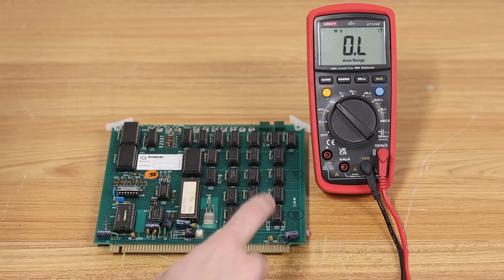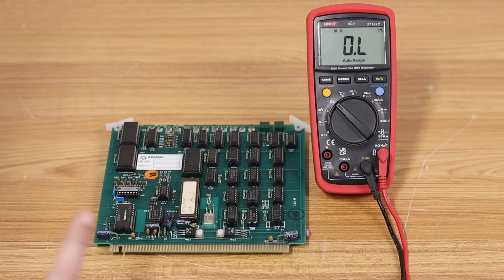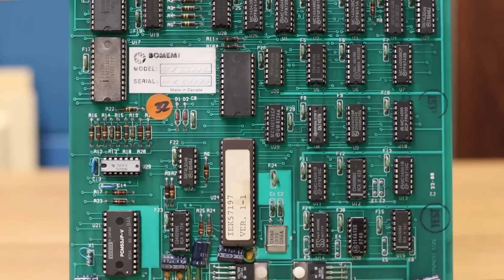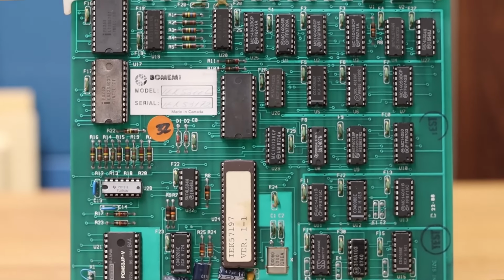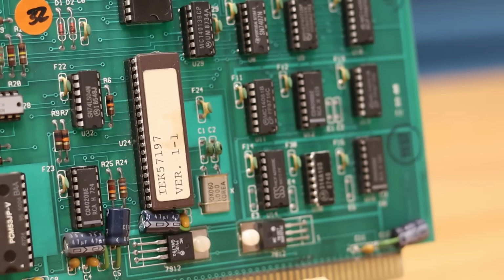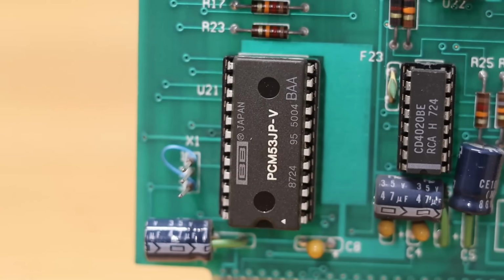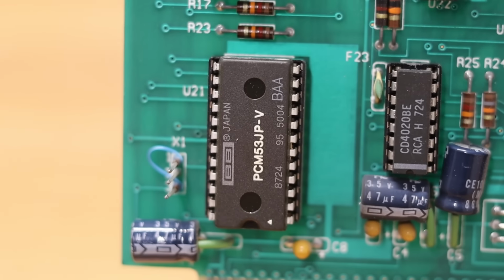And now that we're back home, this is the circuit board that we were missing. This is the board that controls the motors on the fixed mirror as well as the motor for the movable mirror. Without this, we were completely dead in the water. And it's a very cool looking PCB. We got a nice little DAC down here and a whole lot of stuff going on.